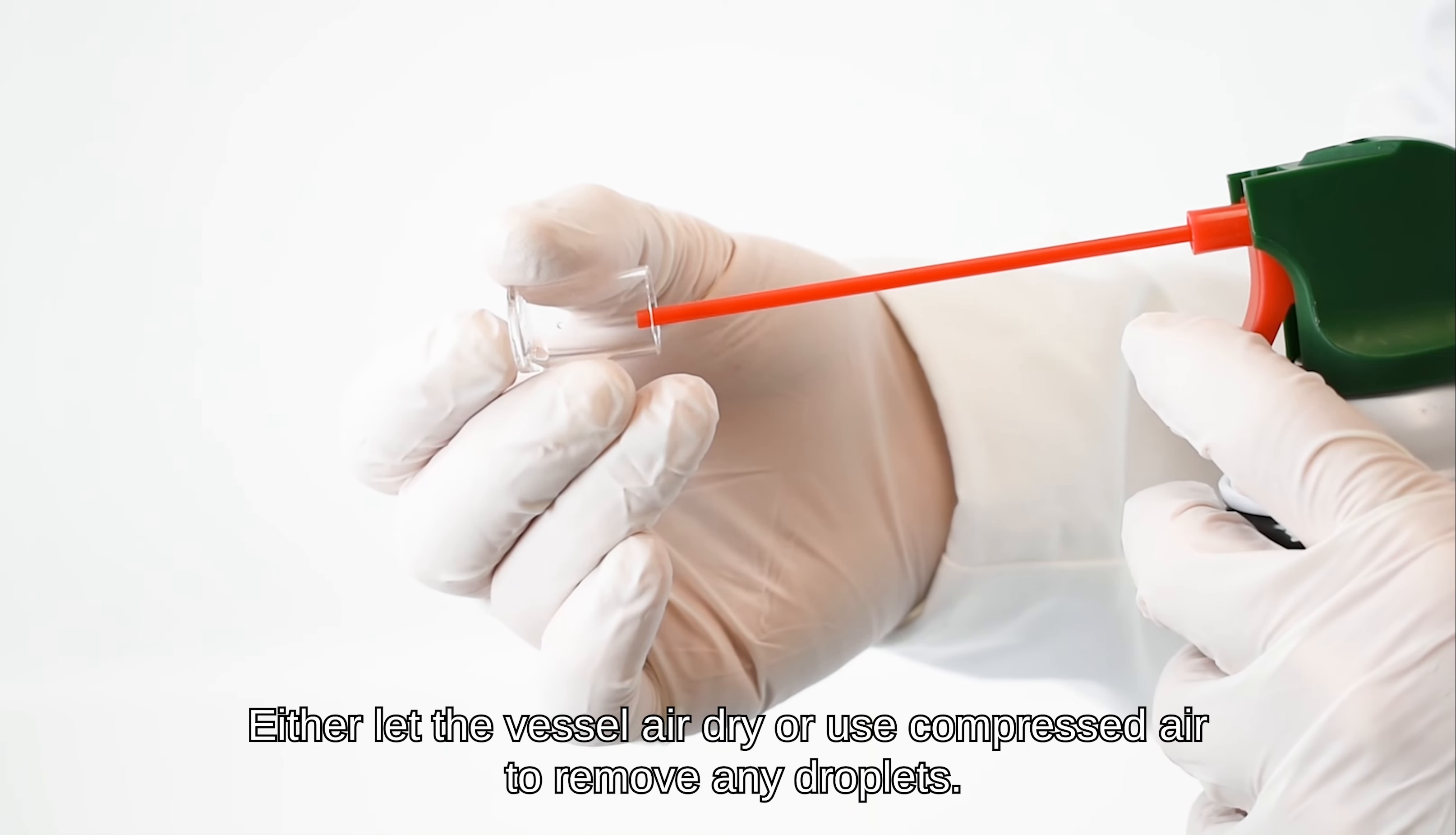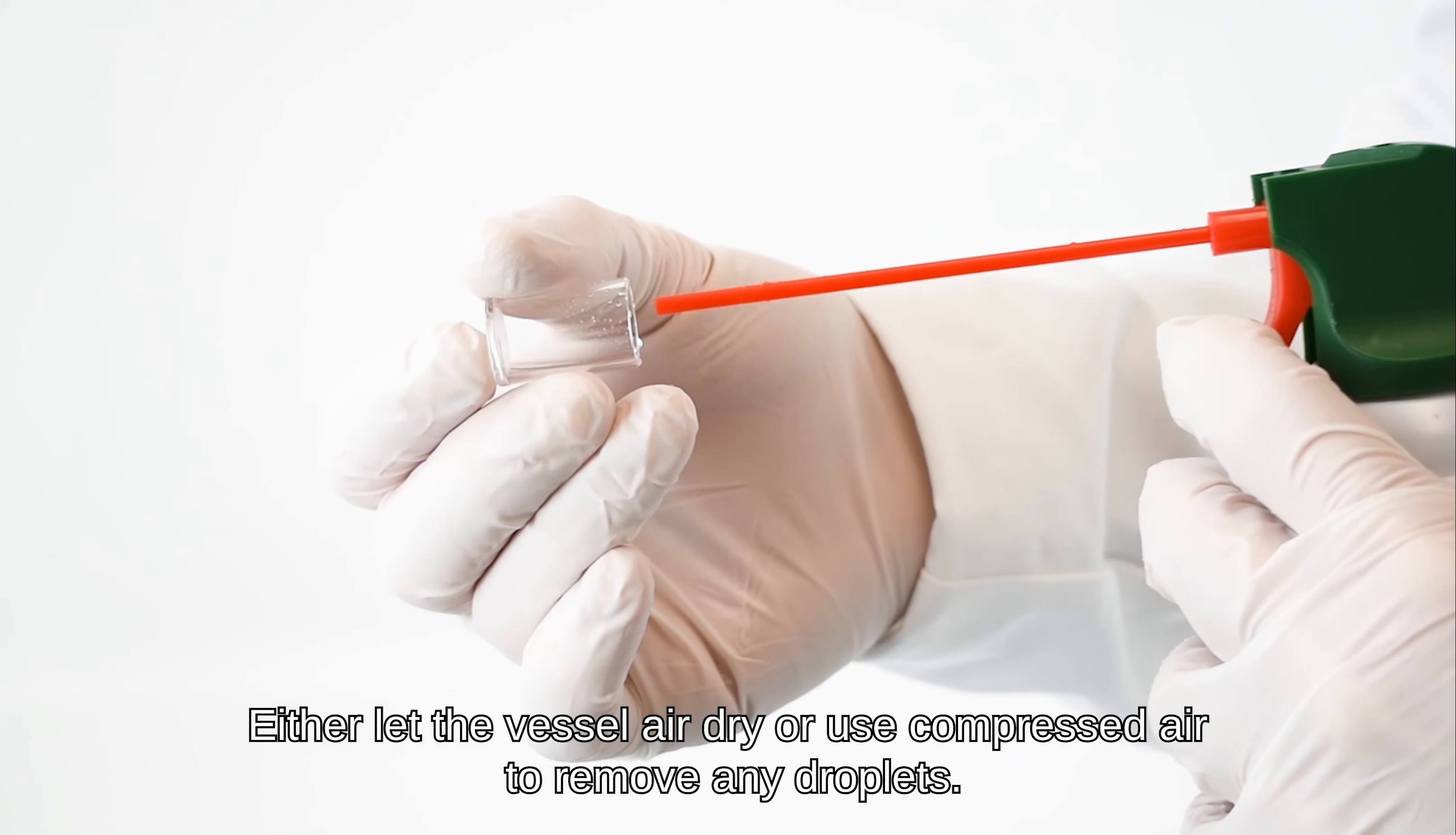Either let the vessel air dry or use compressed air to remove any droplets.